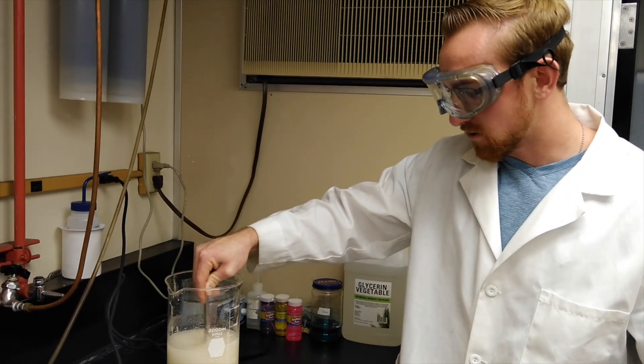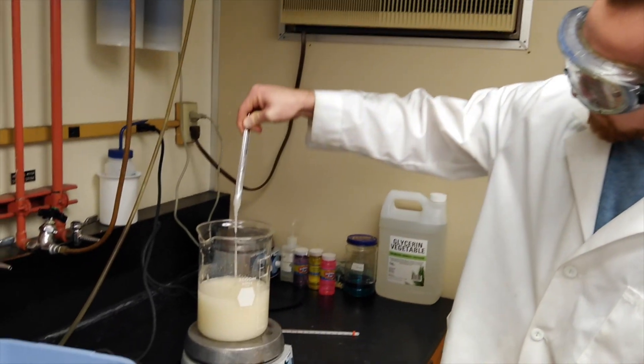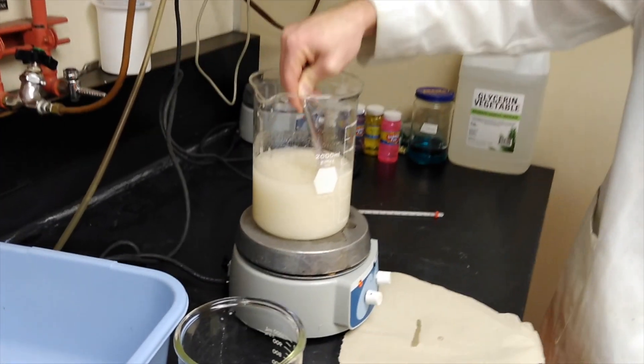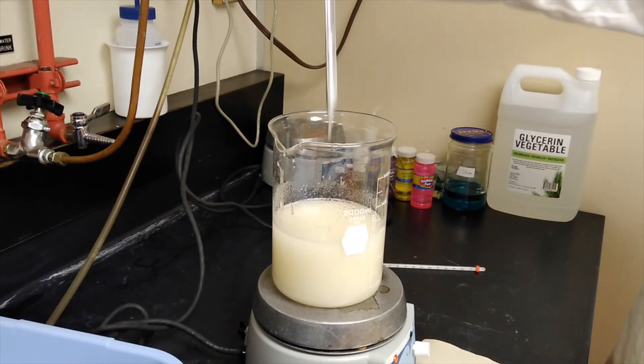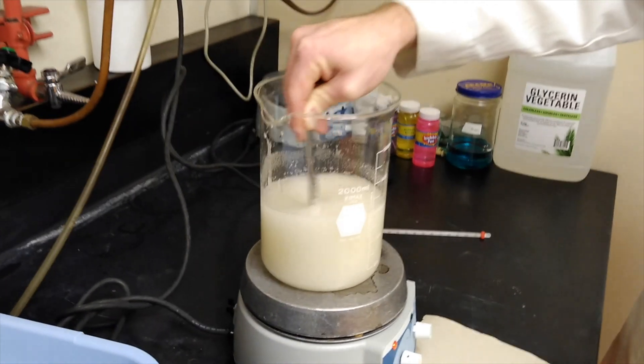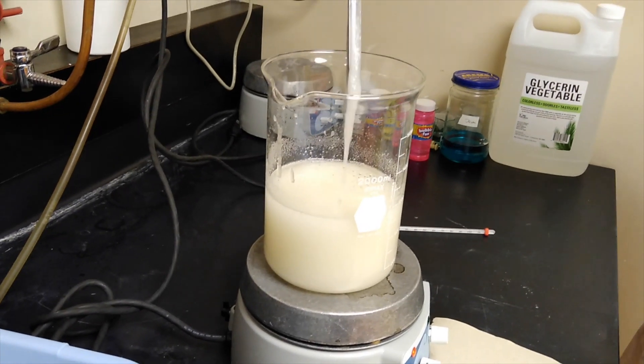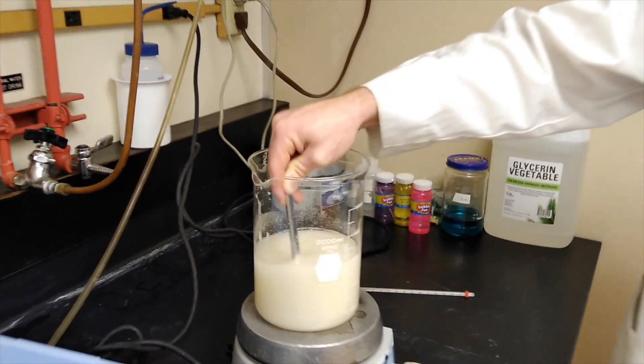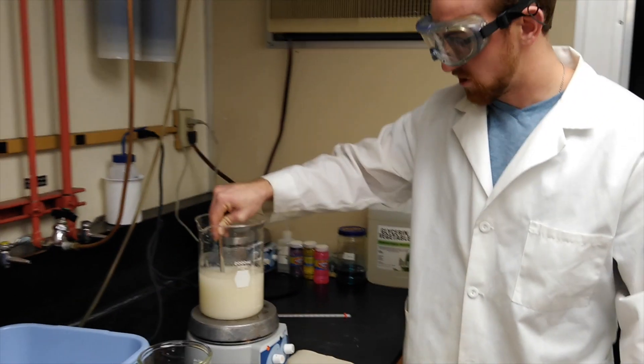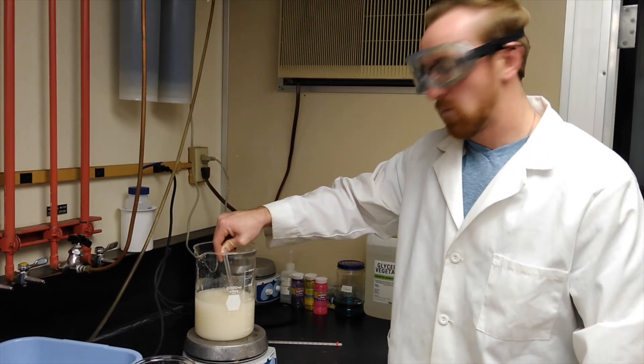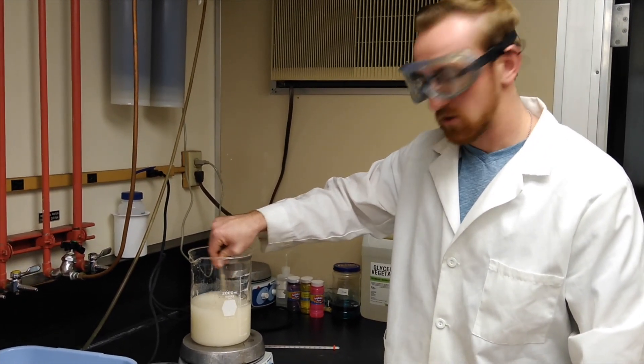Now that we have our sugar solution, looking at the solution, you can see it's very well not dissolved yet. You can very well see the crystals in the water solution there. It's very thick, and it's not clear at all. As we heat up the solution, and we have it stirring, we'll hopefully see the sugar start dissolving when the solution becomes clear.